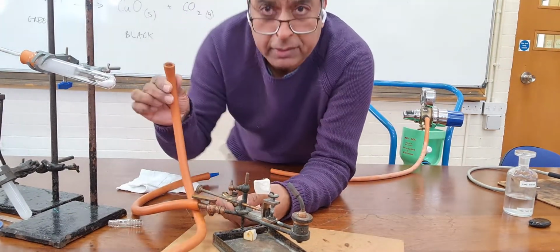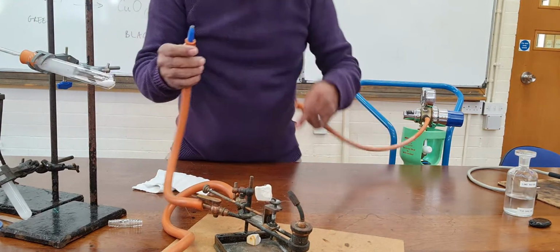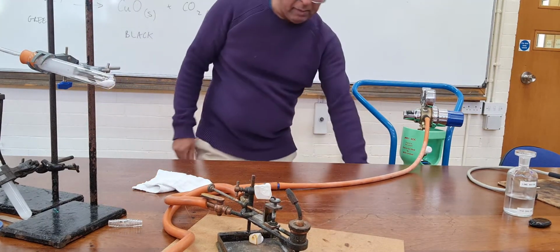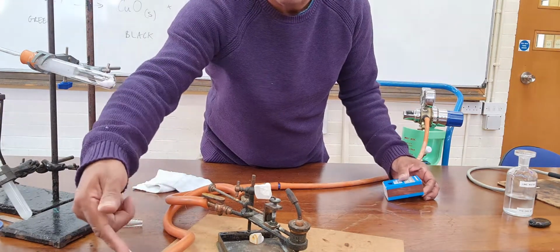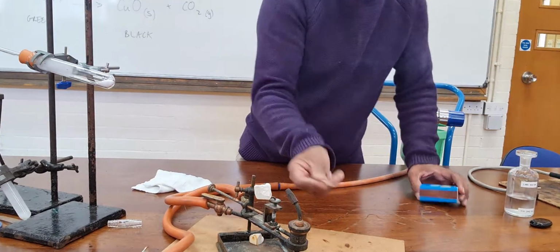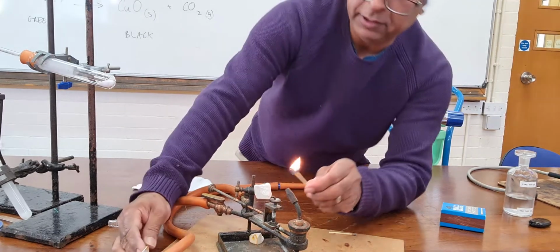And what I'm going to do is I'm going to get some gas. I'm going to put gas onto this burner that we have. It's a special burner. And I'm going to connect the other side to oxygen. Right, let me just see if I can get some matches. Okay, so I'm going to turn the gas on. With the gas on, there should be gas coming through, and I should be able to light it.